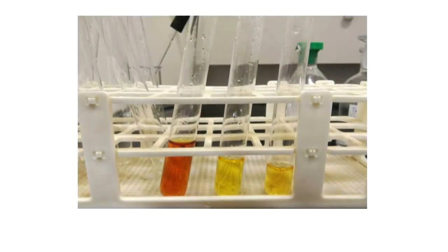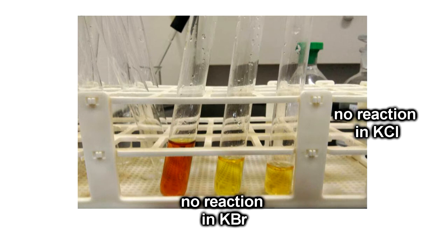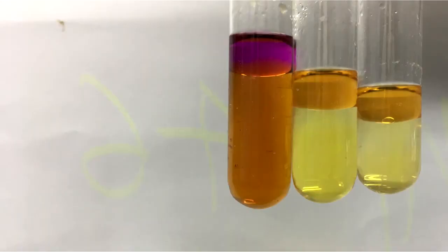When bromine water is added into the test tubes, only the solution containing potassium iodide gives a reaction. When bromine water is added into the test tube containing potassium iodide, the color of the solution changes from colorless to dark brown. The color of the cyclohexane layer is purple when cyclohexane is added into the solution. This happens because cyclohexane detects the presence of iodine.